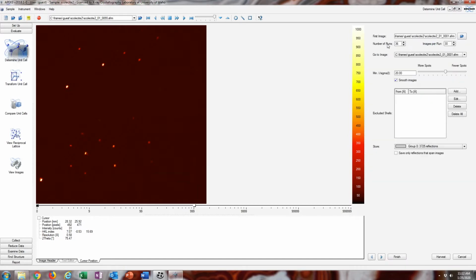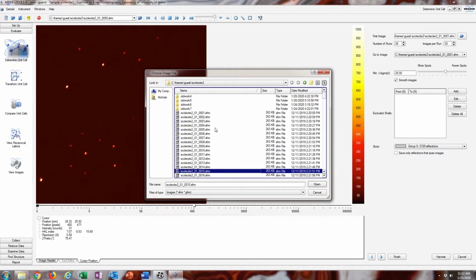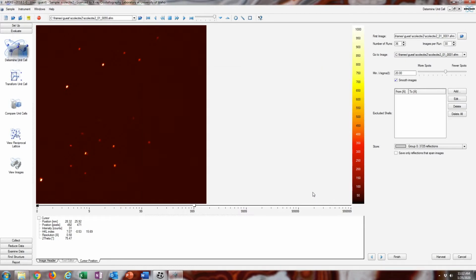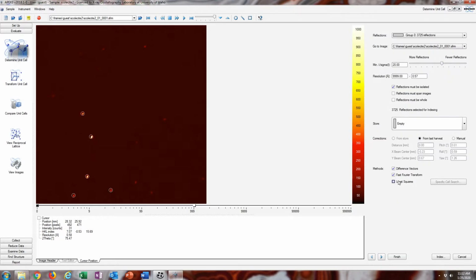You're going to enter the number of runs there were for the data collection that you did, and you can enter images per run. I just increased this to 30. The number of runs is that first digit, so in this case it's 36 runs, and then there's a number of frames per run. I just keep the minimum intensity per sigma the same, and then you can either index this now, or you can take a look at the reciprocal lattice after you've harvested the spots. I like to do that sometimes.